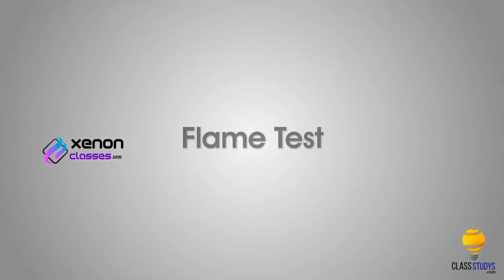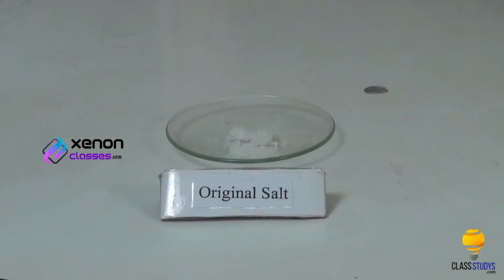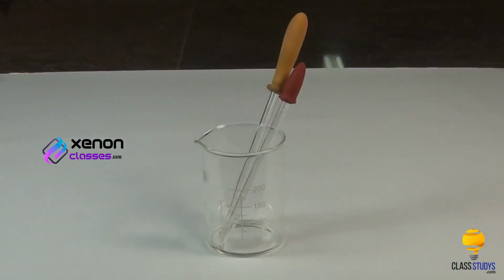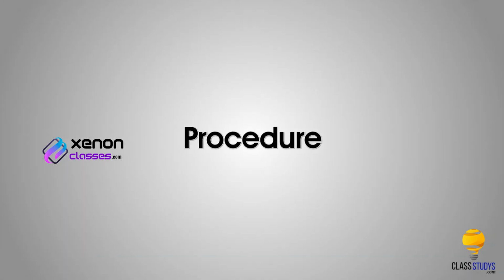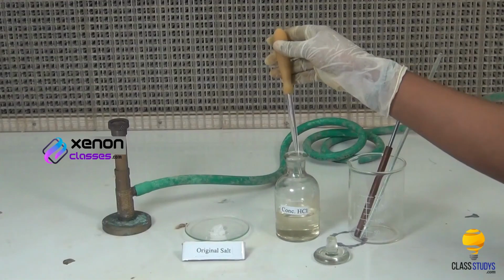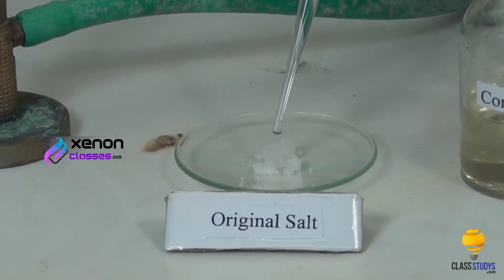Flame test. Materials required: original salt in a watch glass, concentrated hydrochloric acid, dropper, glass rod, platinum wire loop and Bunsen burner. Procedure: take a small quantity of the salt in a watch glass. To this, add a few drops of concentrated hydrochloric acid using a dropper.